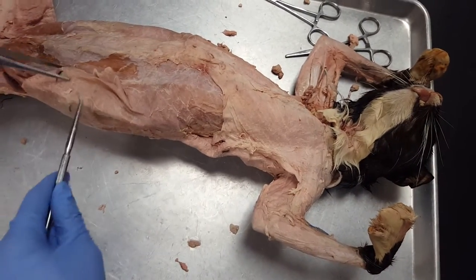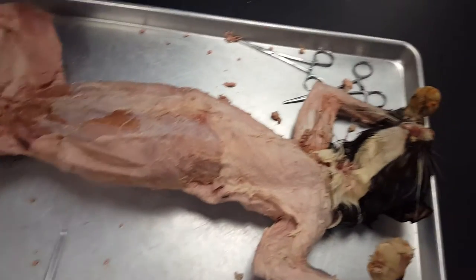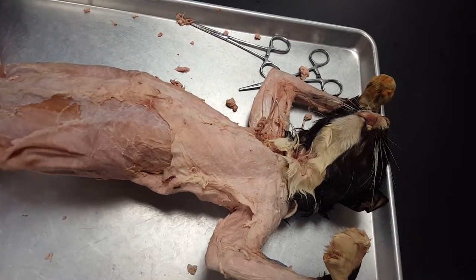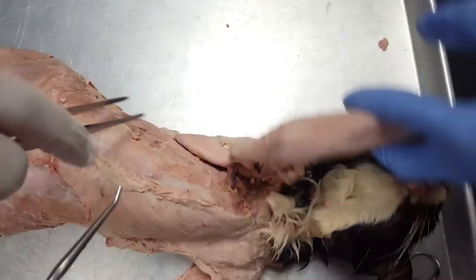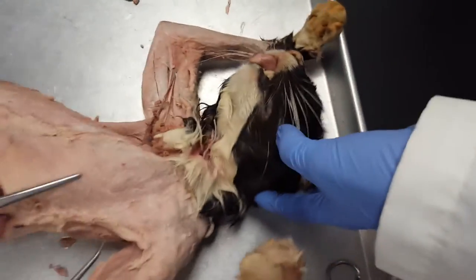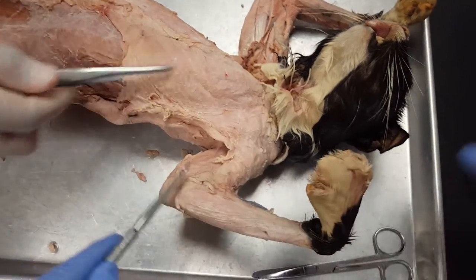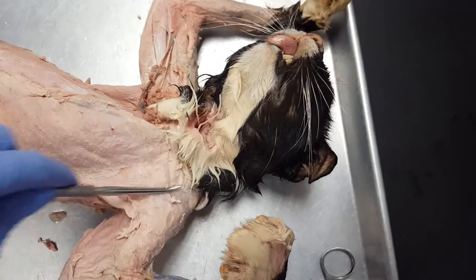So this is the external oblique. This is the internal oblique. Transversus is under it. If you look over here, you have the serratus anterior — it's like the gills. You have your pectoralis group. And then right here is your deltoid group.